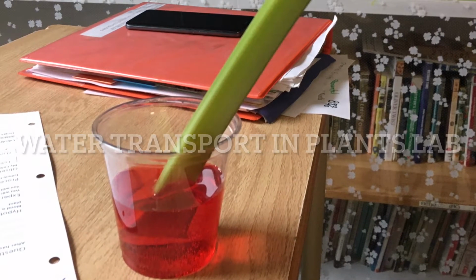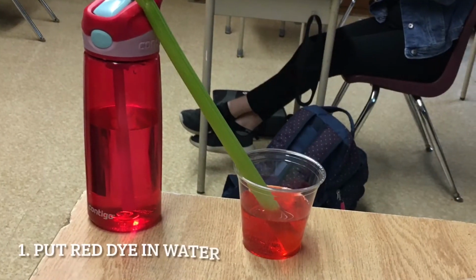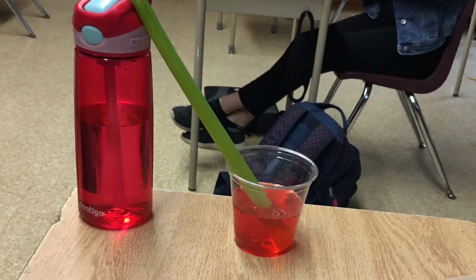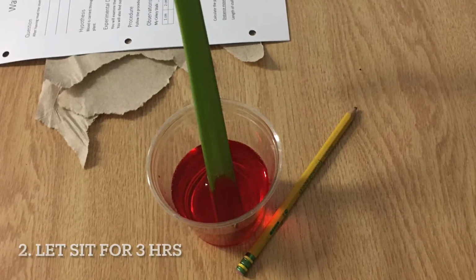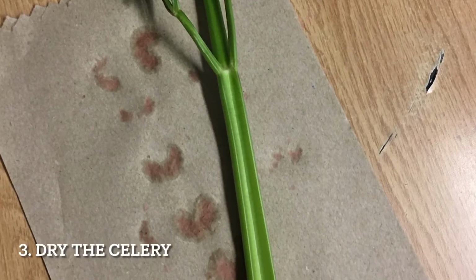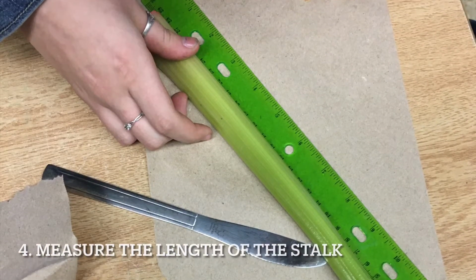Alright, so we're going to do water transport in plants. The first thing we did was we put some red food coloring into the water. Then we added our celery and let it sit for 3 hours. We then took the celery out and dried it off with a paper towel. And then we measured the length of the stalk.